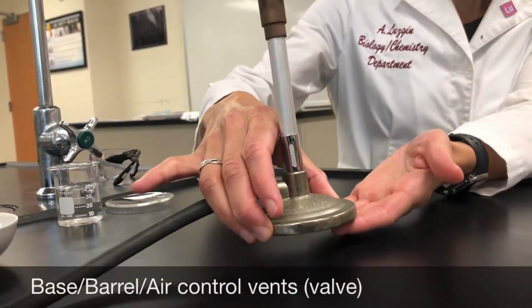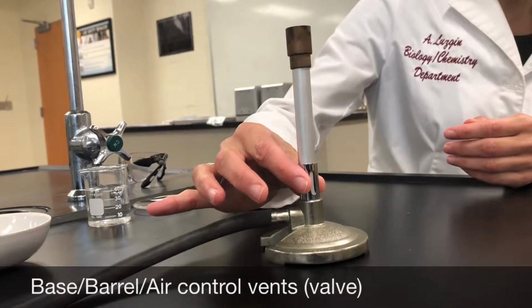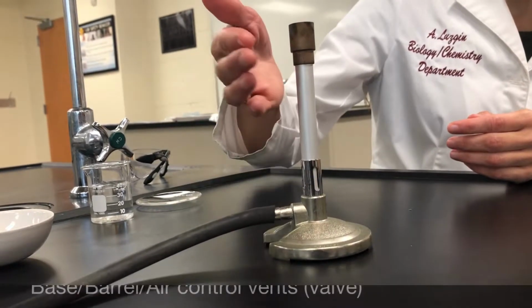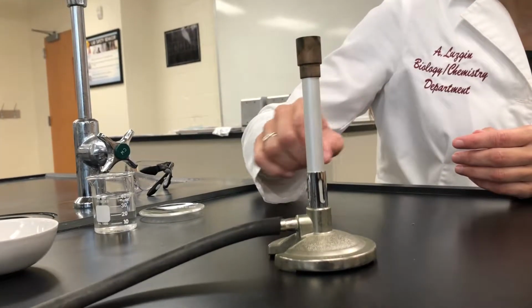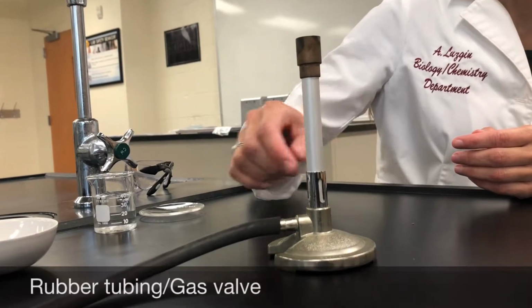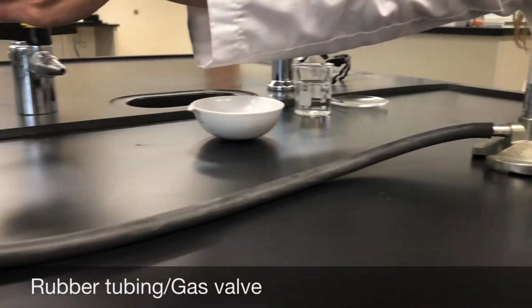Let's take a closer look at the parts of the Bunsen burner. So here is the base of the Bunsen burner. This is called the barrel. These are the air valves that control the amount of oxygen. This is the top of the barrel. This is where the lit match will be put. And then here you have the rubber tubing, okay, attached to the gas line.